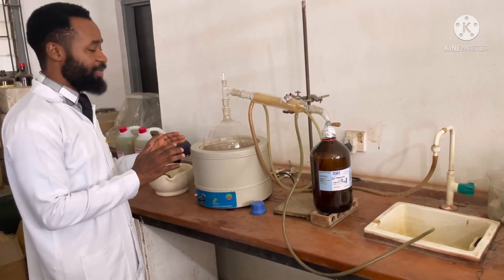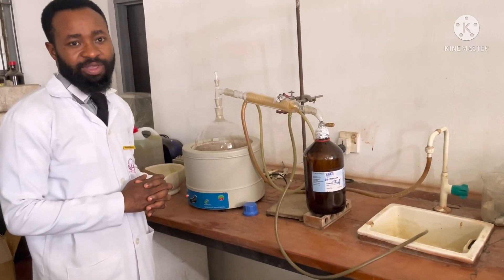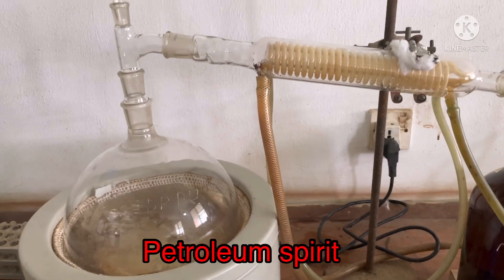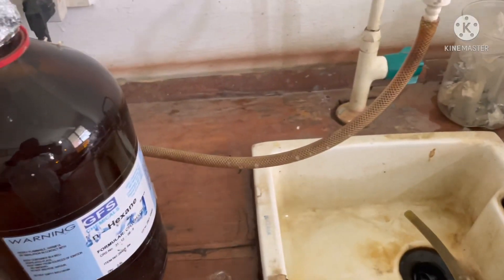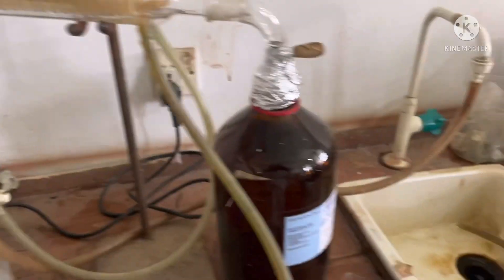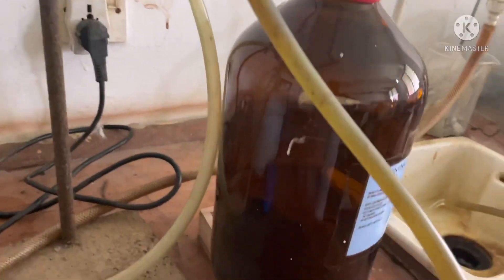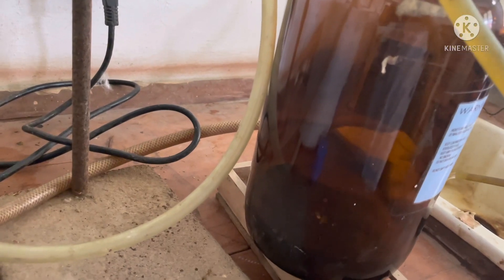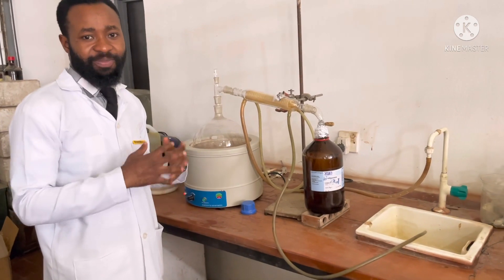All I care about is 95% recovery of the petroleum spirit. The boiling point of petroleum spirit is between the range of 60 to 80 degrees centigrade. As you can see, this is the water used for condensing, and the water is going out while this is boiling, and we have the pure form of the petroleum spirit being collected.